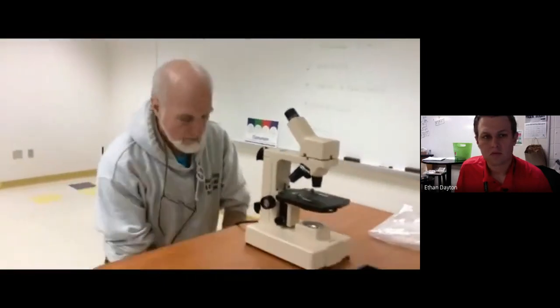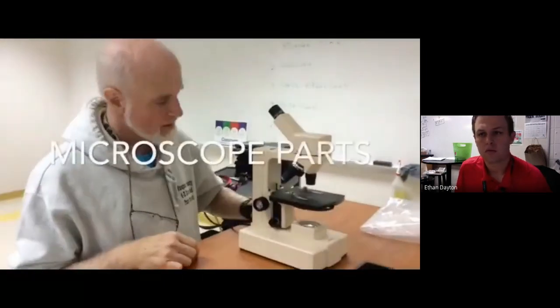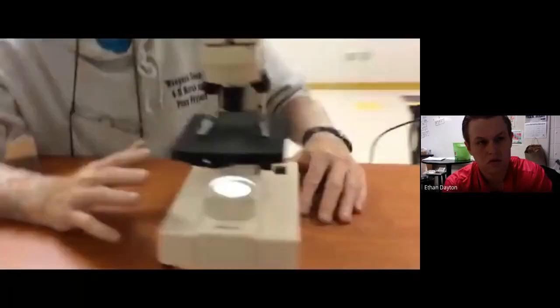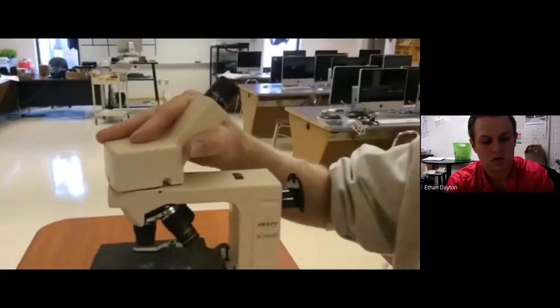You just then plug it into the plug. We have turned the light on to be sure it's working. Now it's time to go over the parts. We have the eyepiece on the movable head of the microscope.